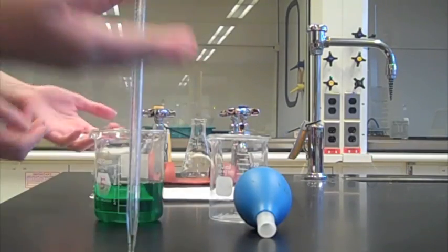Time to get extreme! I can solve your problem by using a pipette. A pipette? How do you use one of those?